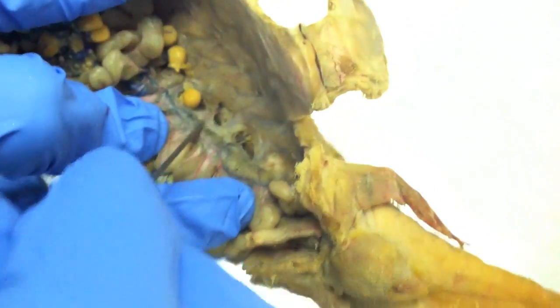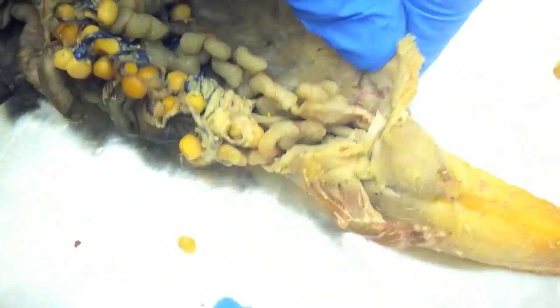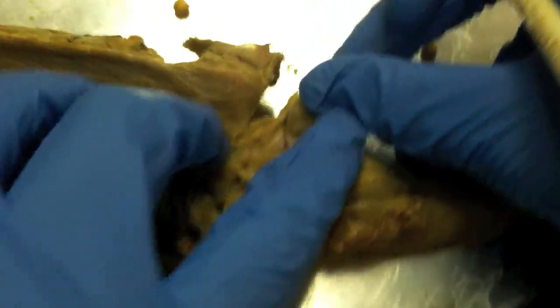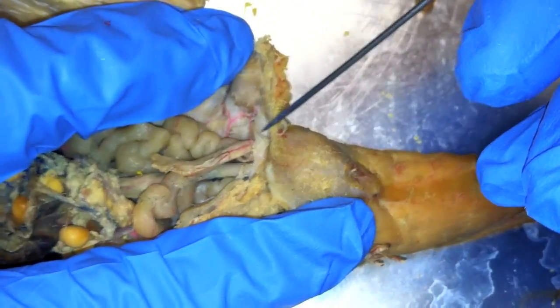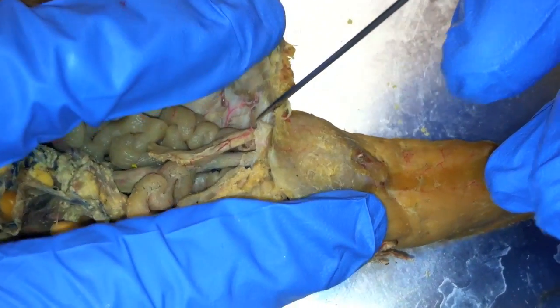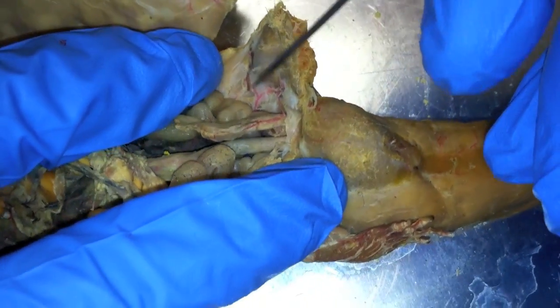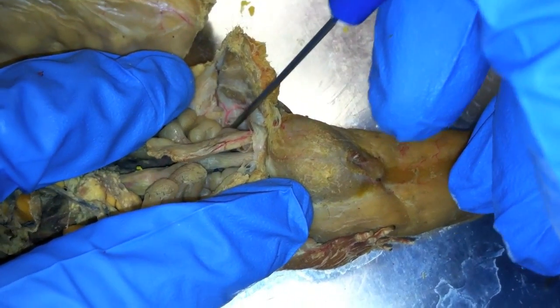You have renal arteries and renal veins going up here. This really little one right here is the hypogastric, and then it branches off — the one that goes up here is the epigastric, and the one that goes down is the iliac.